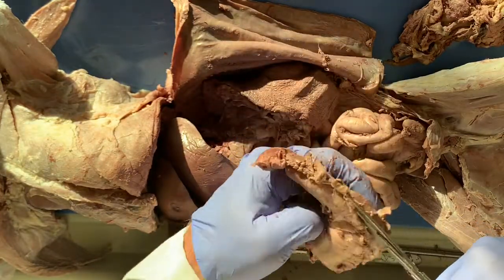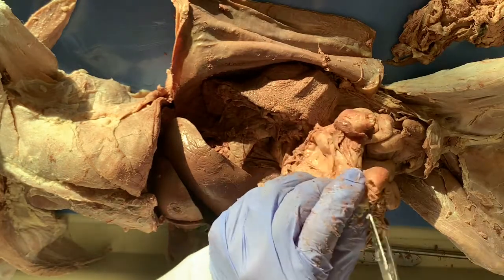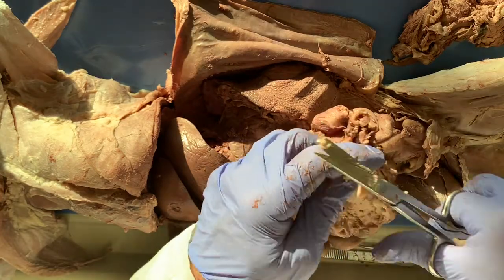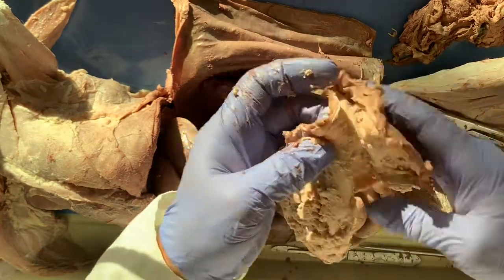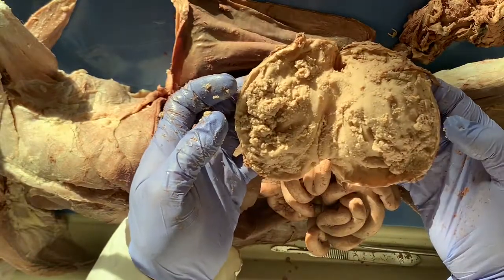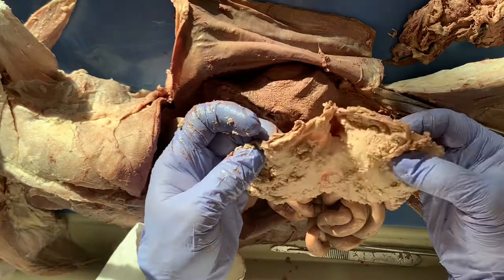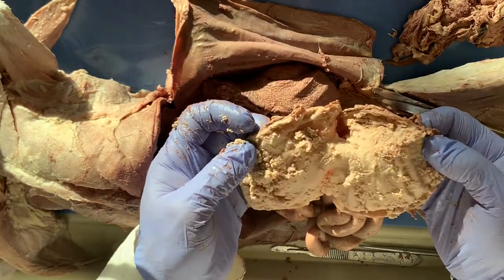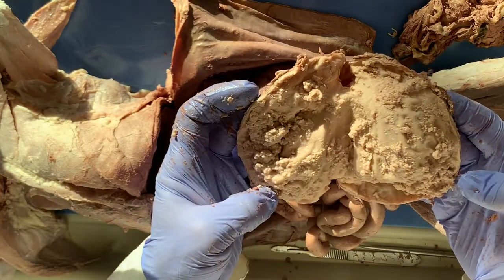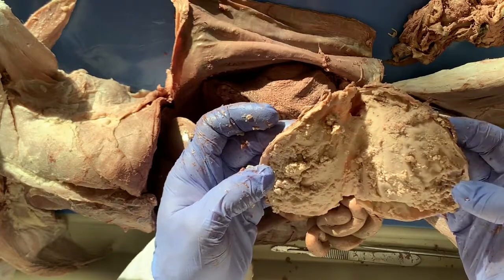I'm going to cut it all the way through the greater curvature until it comes out of the beginning of the duodenum. So, not terribly exciting. What we're looking at primarily is just kibble. Sometimes you'll see insects in here, sometimes you'll see hair, sometimes you'll see worms. Mine is a little bit boring. So let me wash this out, and then I can go over the parts of it with you.